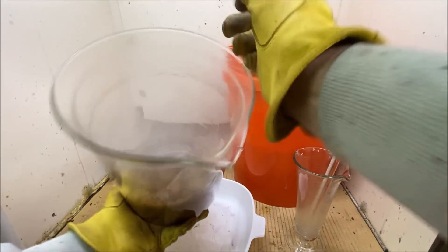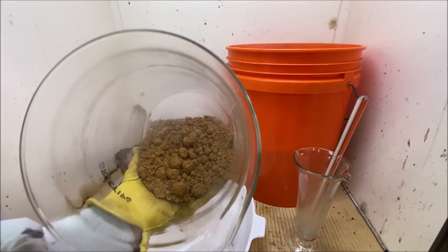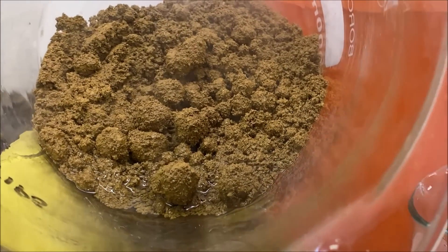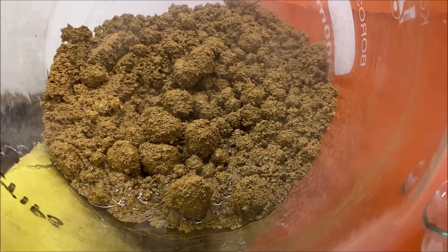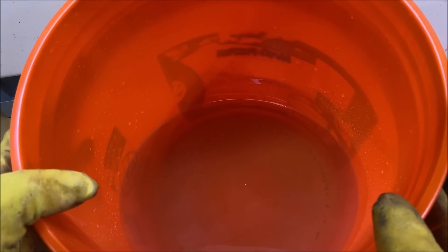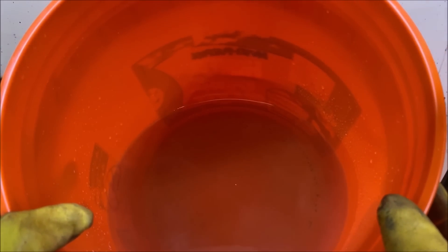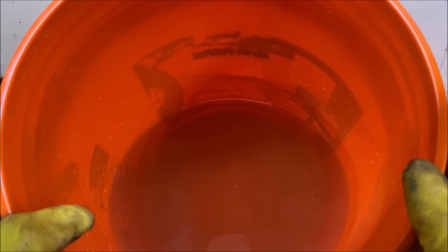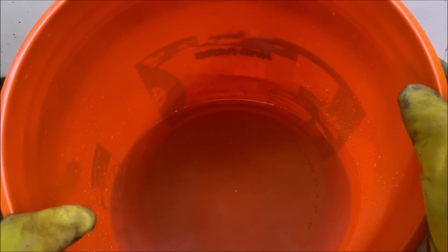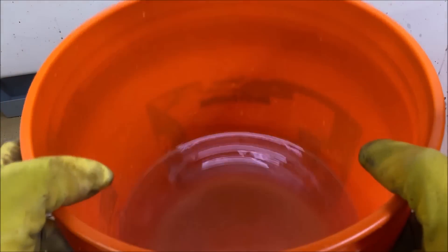Here's what the pure gold looks like down inside the beaker. Here's what our rinse water looks like — there's a light dusting of gold on the bottom of this bucket. Once it settles out completely I'll pour the rinse water into my stock pot and recover that little bit of gold out of the bottom.